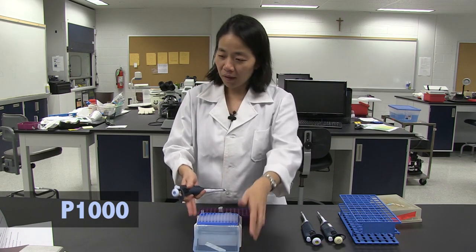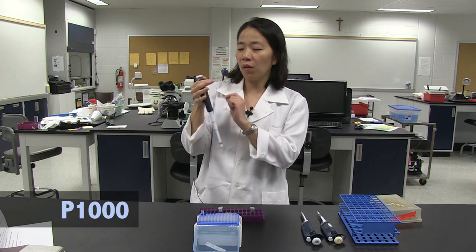I'm going to demonstrate how to use a micropipetter with a P1000, pipetting 250 µL of liquid. This is set at 025 for 250 µL. You should get a general idea of how to hold this — with my thumb at the plunger and my fingers down here. To get an idea of how this works, press your thumb down until you can feel a slight resistance. That's what we call the first stop. How far down you press depends on what the volume is set to, so you press further down at higher volumes.